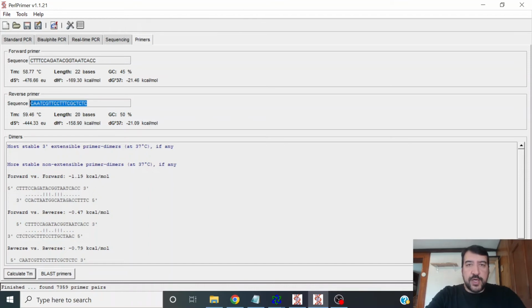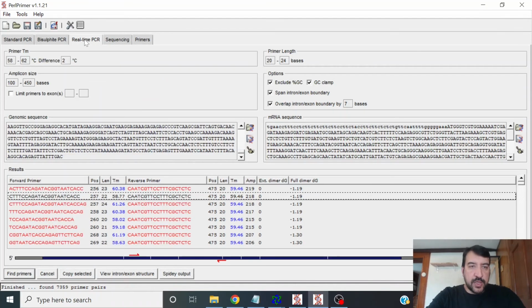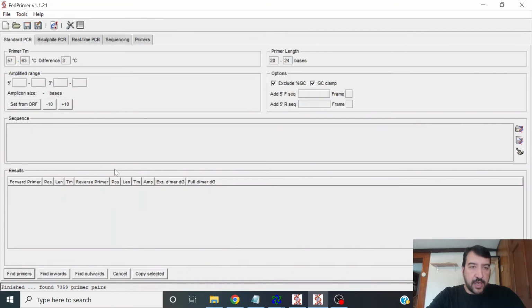Now, if you wanted to do qPCR and not qRT-PCR, you wanted to do qPCR on just plain old DNA, you would do exactly the same thing, except don't come to this real-time tab. You can just go to standard PCR and paste in your sequence and then run the same basic thing without worrying about whether your primer crosses a splice junction. It's highly desirable to design your primers with a program, and I design even sequencing primers with a program because they tend to give better results.